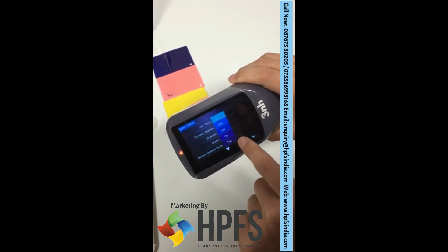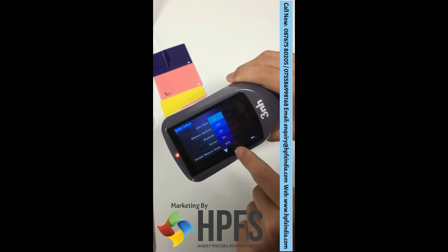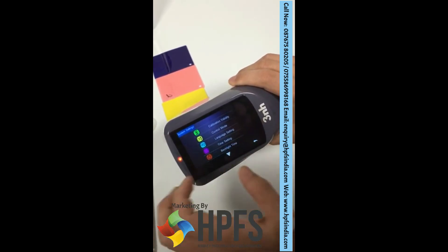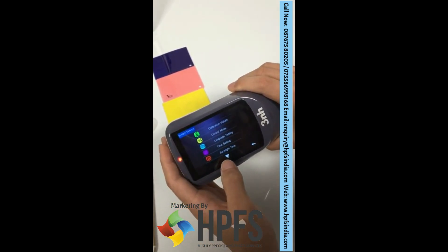Sample measurement — you can change SCI and SCE here. Those are the general system settings. Okay, that's all.